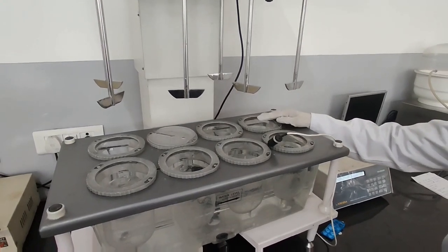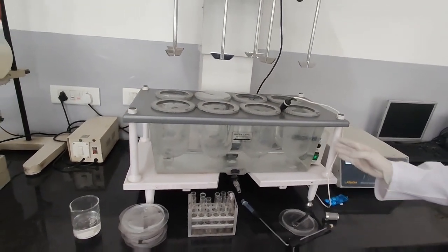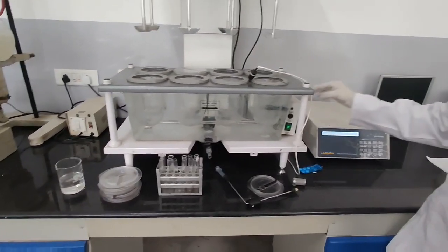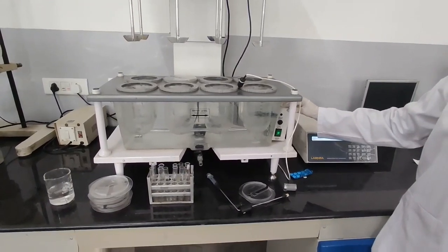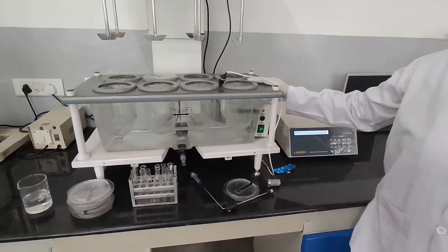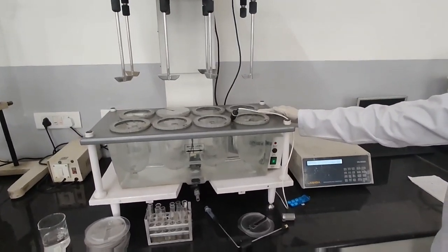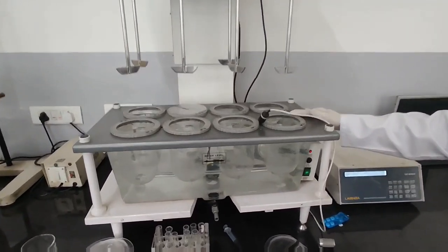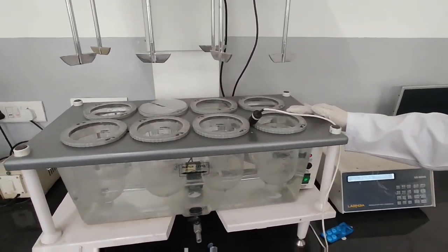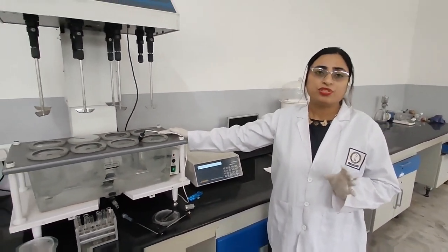We will fill the dissolution media in this. Next part is this water bath, and third part is this heater. It is used to maintain the temperature of this water bath and the dissolution media. Before working in the dissolution test apparatus, we are to switch on this apparatus at least 30 minutes prior to conducting any dissolution study, so that temperature is well maintained during the whole process.